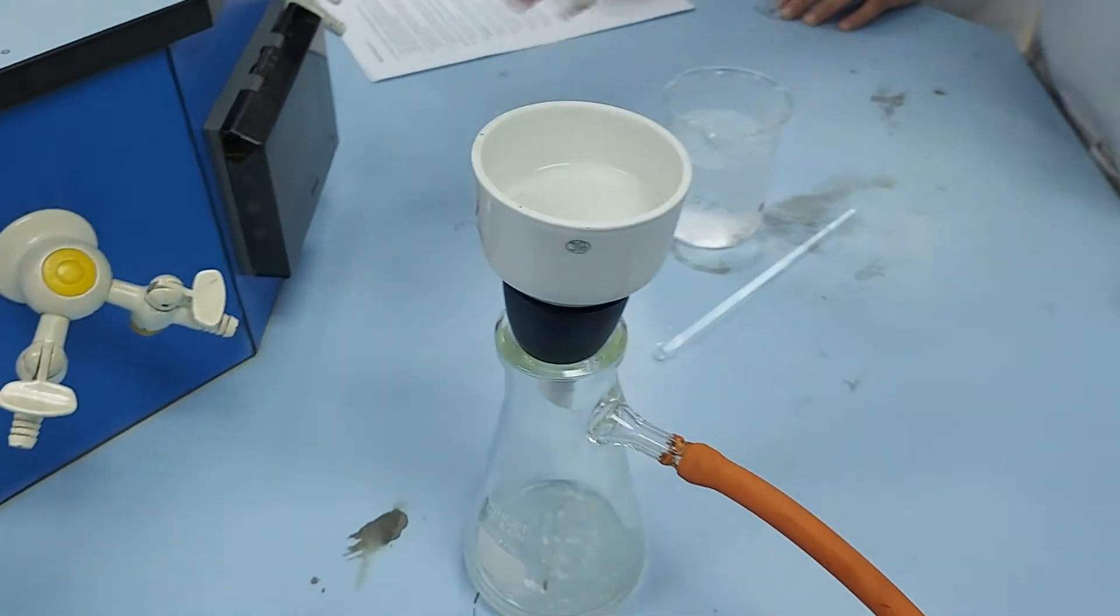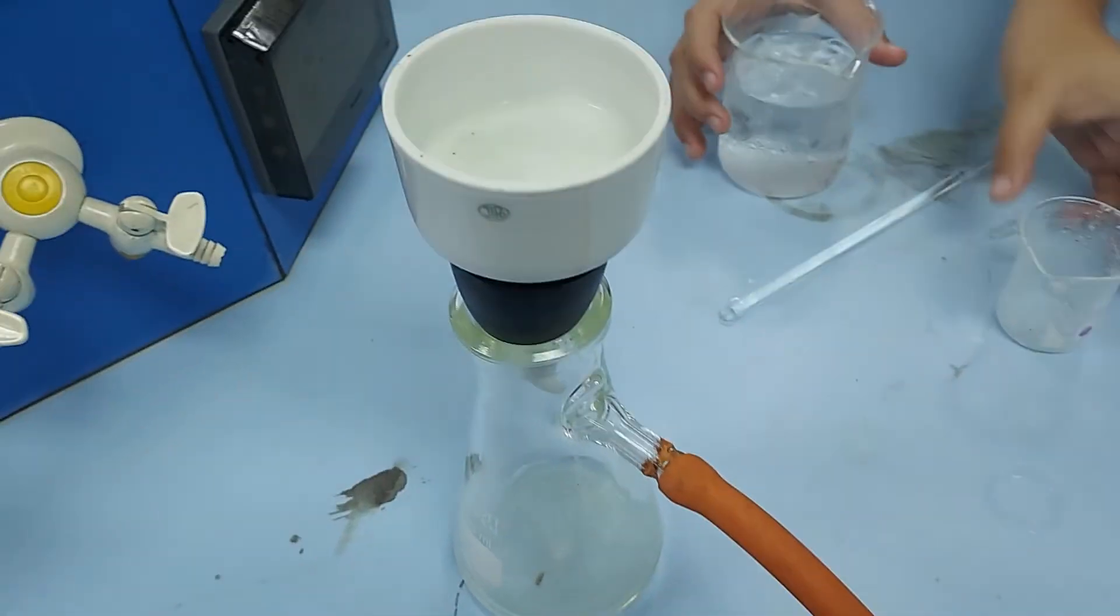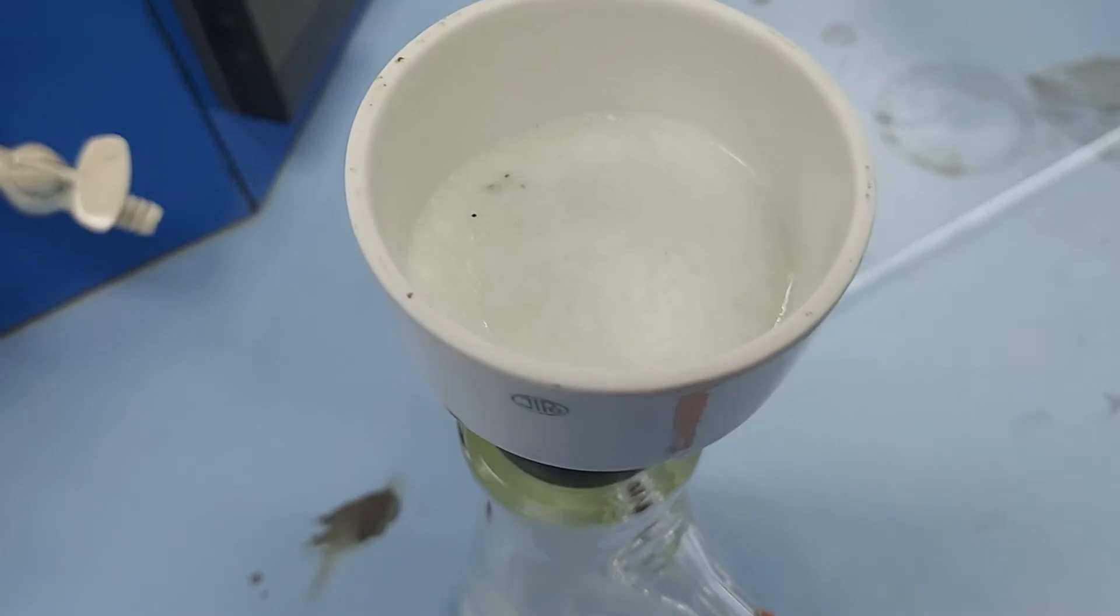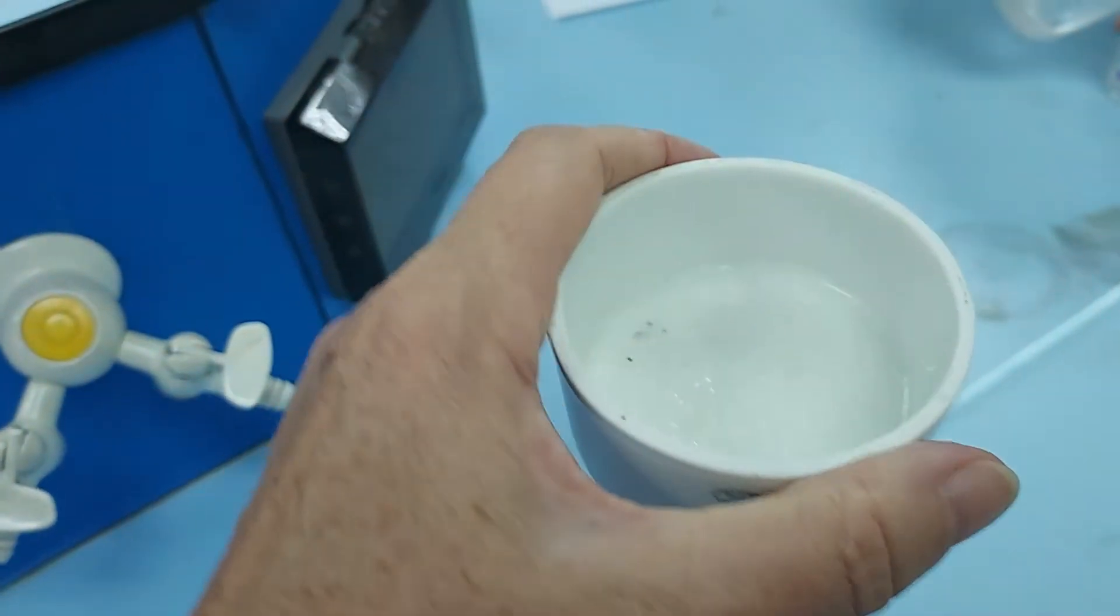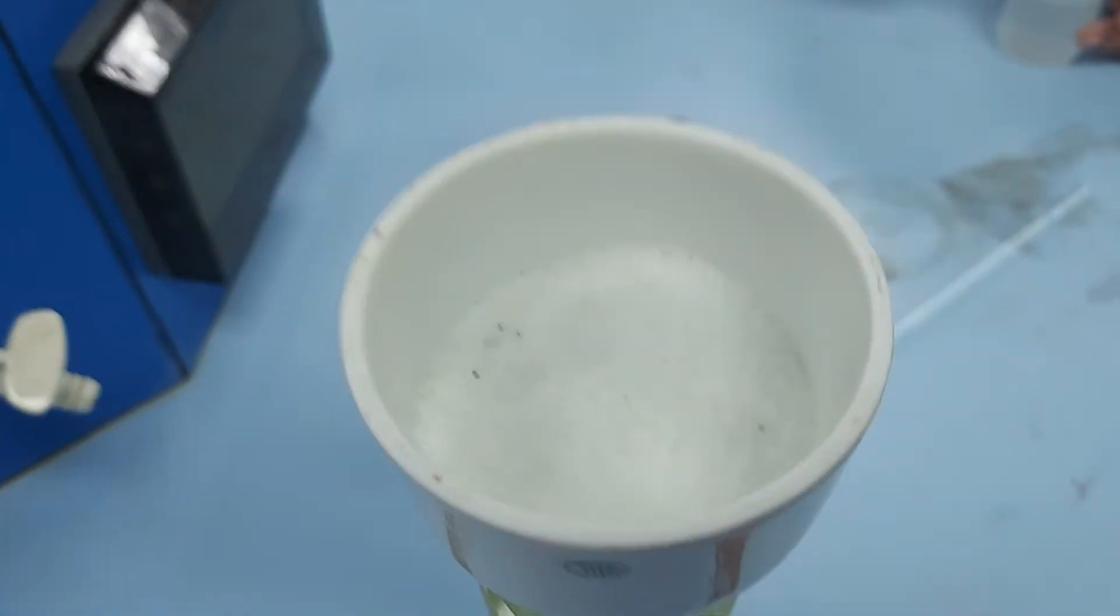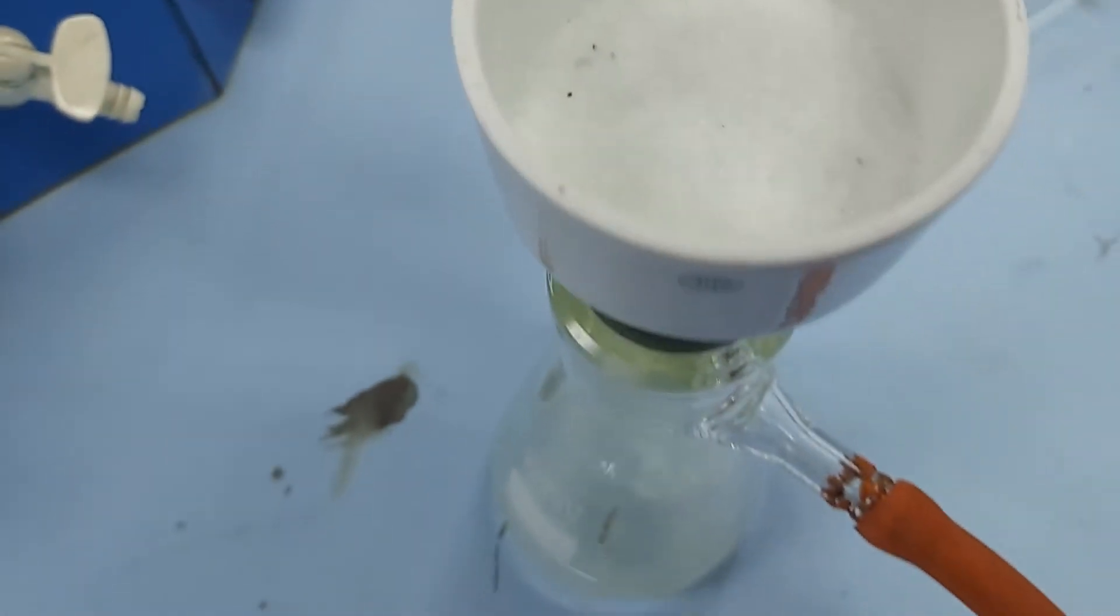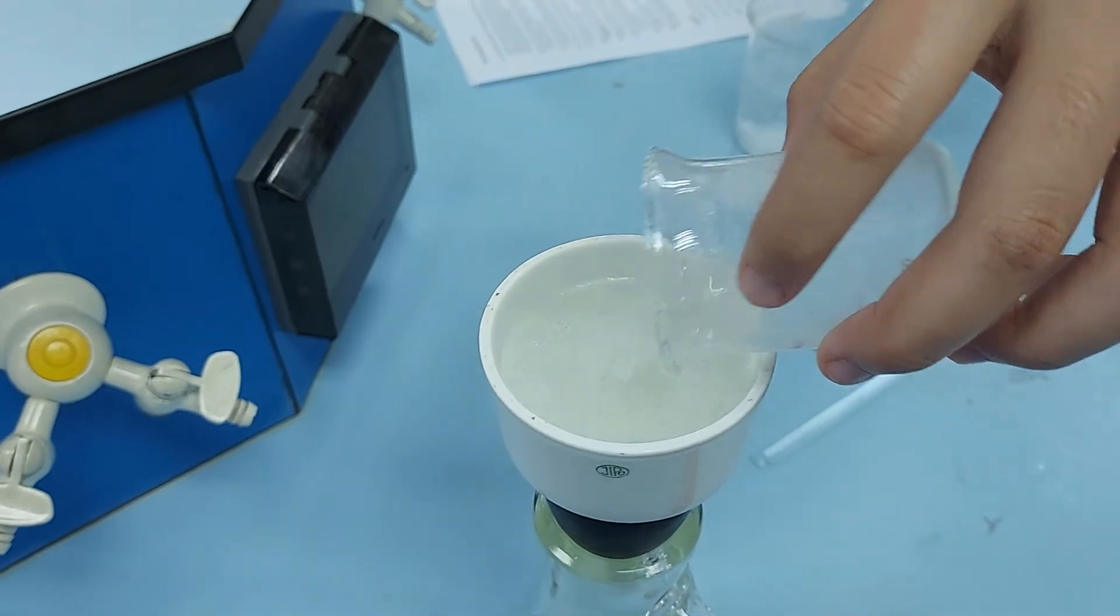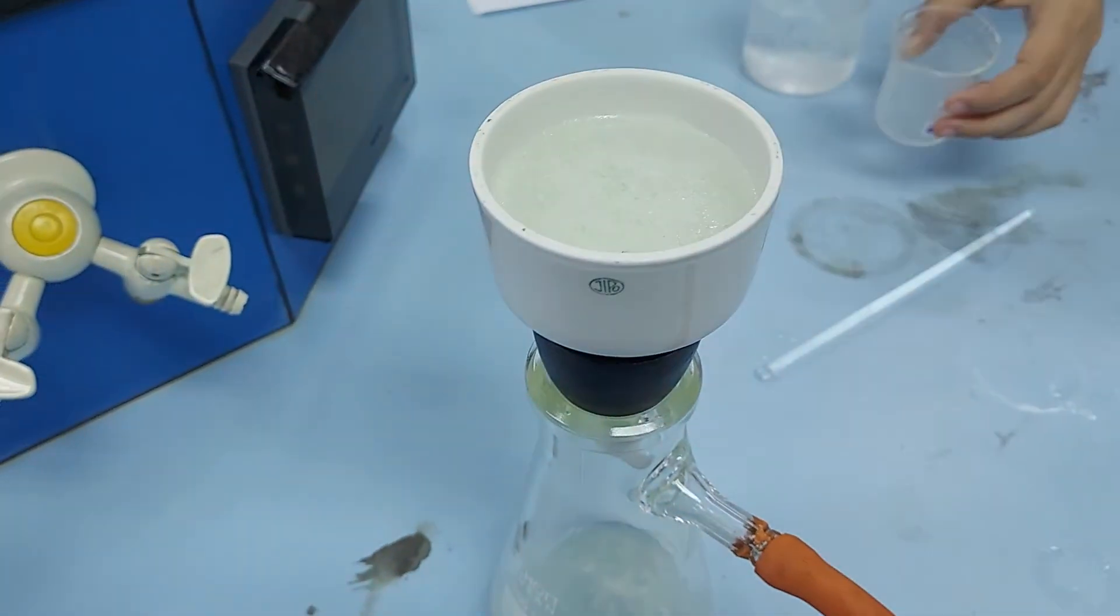Okay, so the crystals have now formed. They've been put in the ice and we have vacuum filtration. We're going to now wash the crystals with ice cold water to remove any impurities.